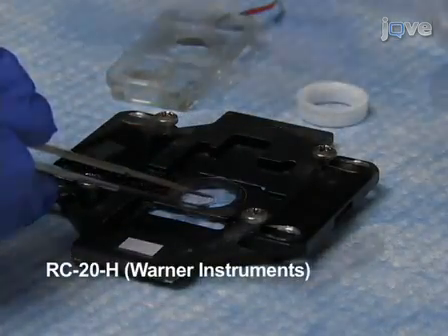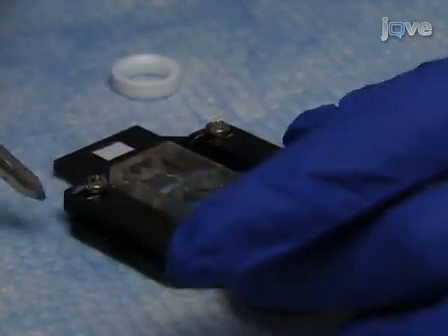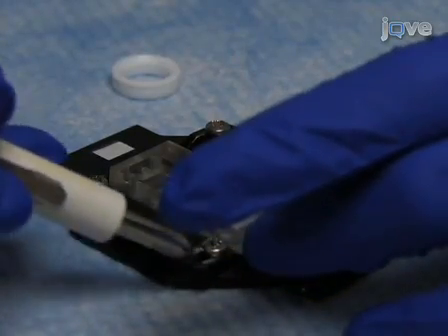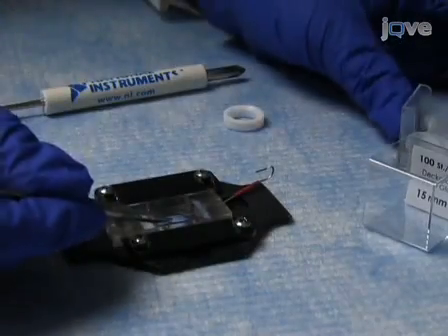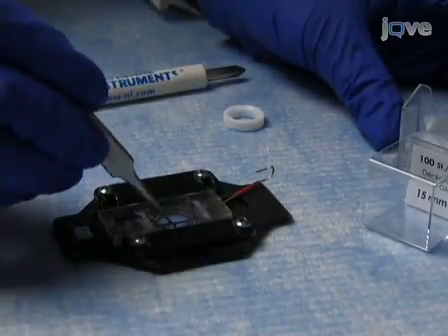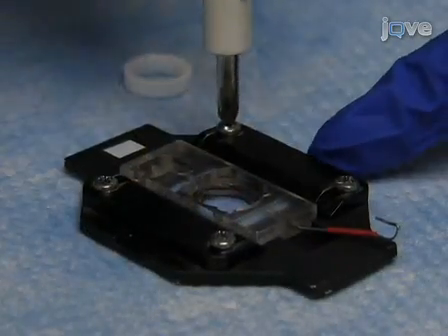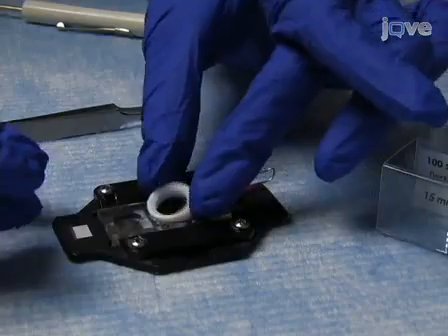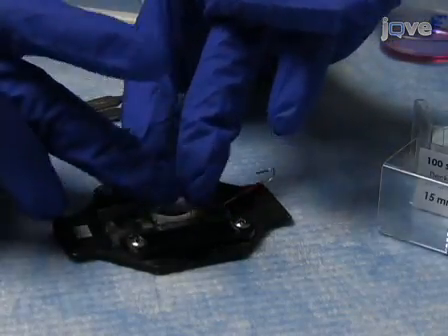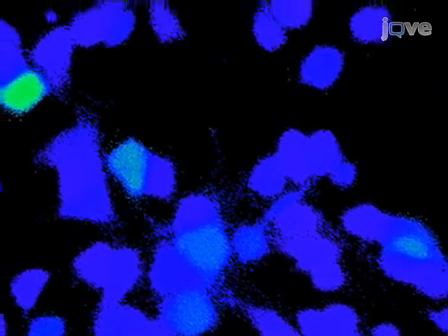We use the RC-20H imaging chamber by Warner Instruments. Apply vacuum grease to both sides of the chamber. Then place the coverslip onto the chamber and gently press it into position. Next, screw in the side clamps, then insert the coverslip retainer ring. Once the cells are mounted and the imaging chamber is assembled, proceed with the calcium imaging step.